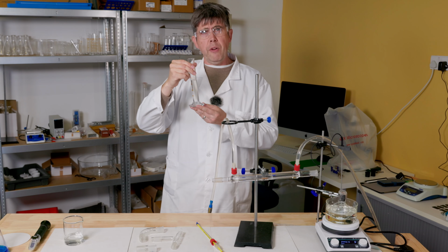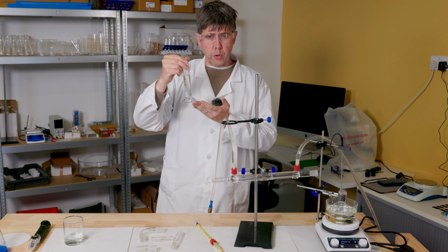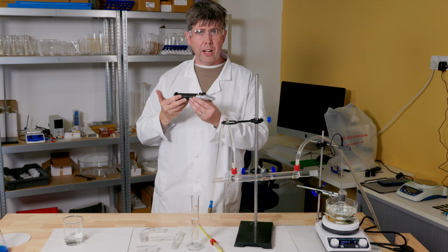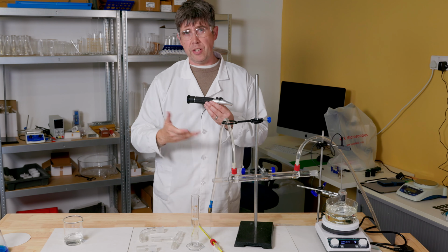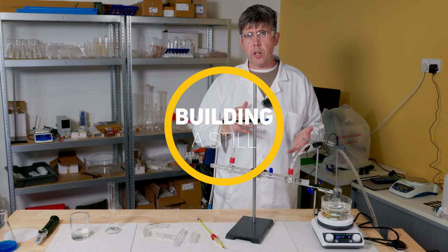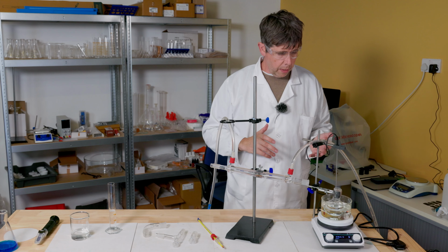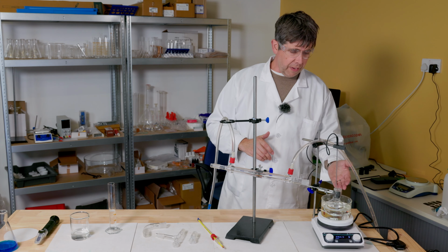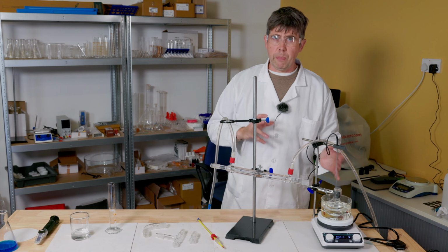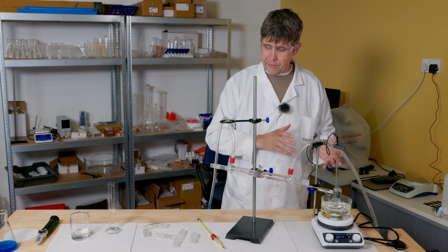This time I have a mixture of ethanol and water, which my alcohol refractometer here tells me is 20% ethanol. I thought it would be useful to show you how all of this equipment is assembled. First of all, I've got my round bottom flask, which contains my mixture and a few anti-bumping granules so that I get a nice even boil.